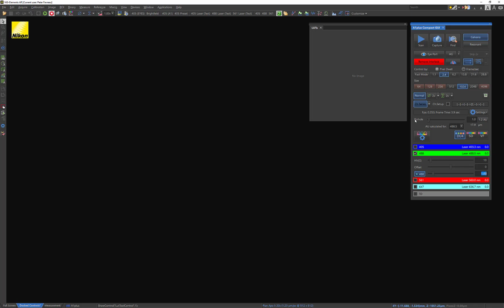And this is a setting that's actually integral to confocal microscopy, because of course confocal microscopy is only possible by employing a pinhole. The pinhole, of course, is there to reject out-of-focus light so you can get very crisp-looking images. And basically, by increasing the pinhole size, you allow more light in, but you also allow more out-of-focus light. So you might get a brighter signal, but it's going to be less resolved than if you used a smaller pinhole size. So you can choose to increase this above what's already calculated for a specific wavelength and objective, but I would honestly say it's probably better to keep this at whatever the suggested value is.